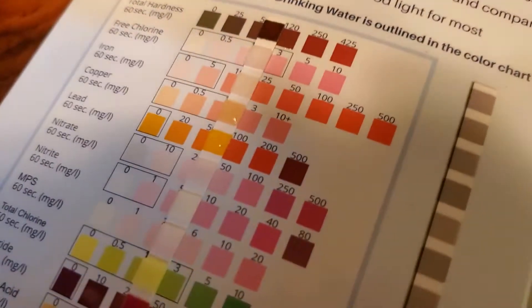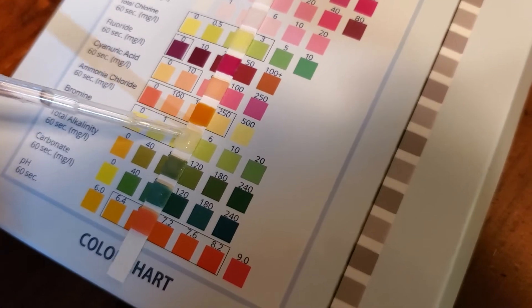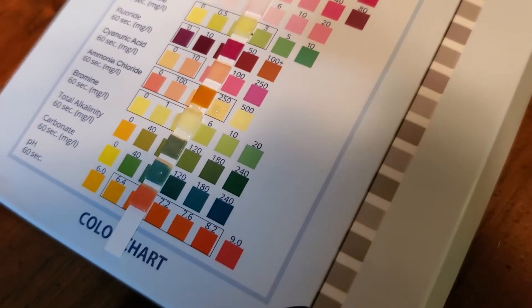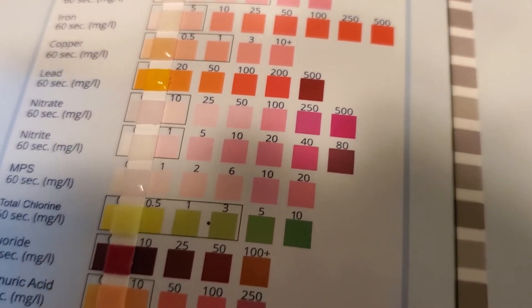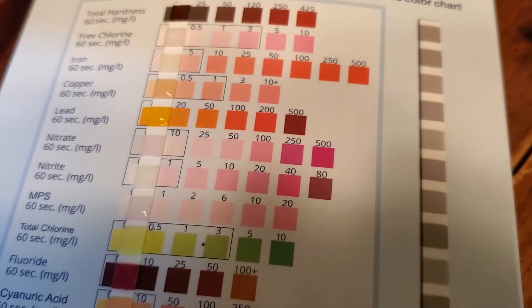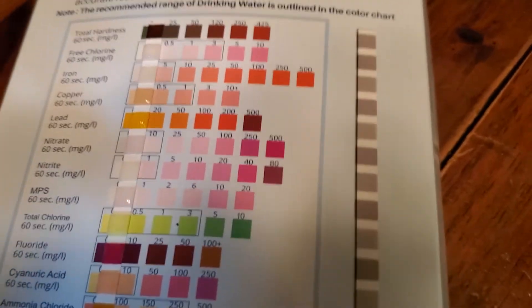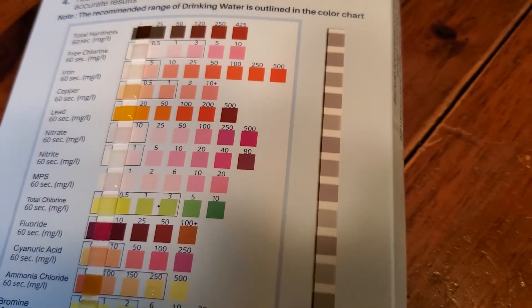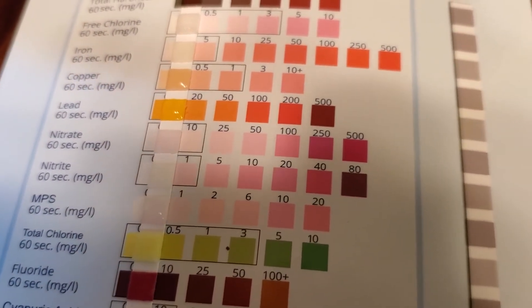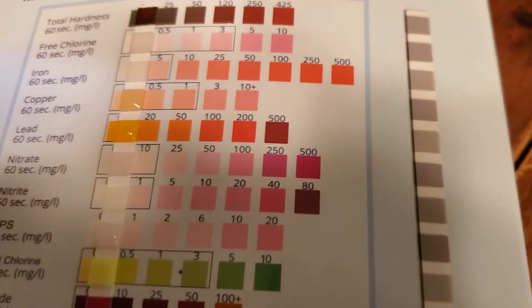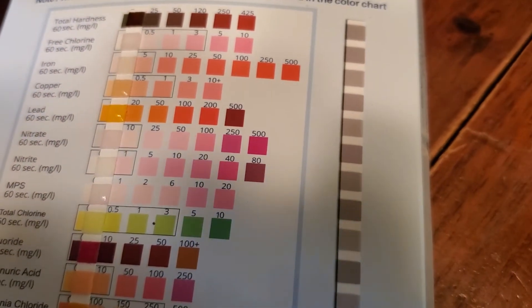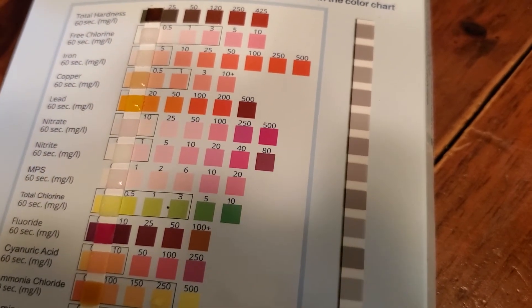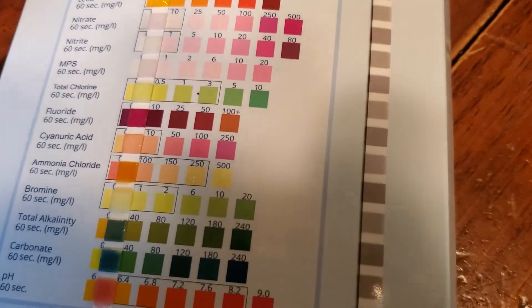Still that bromine still isn't doing a damn thing, it won't even suck up the water. It's just bubbled there, that's weird. It's like defective. Oh well I guess we're not too worried about it. But the lead one, see now it definitely looks like it's lighter than the zero color. The lead is just so close. This is why if anything is even slightly questionable you need to call in a professional. I know there are people in the world whose color vision acuity is so perfect that if you change the hexadecimal code in something by one freaking digit they can tell it apart. Have you ever done the color vision acuity test? Yeah. It's like line these all up as they get darker. No sir, not in this lifetime.